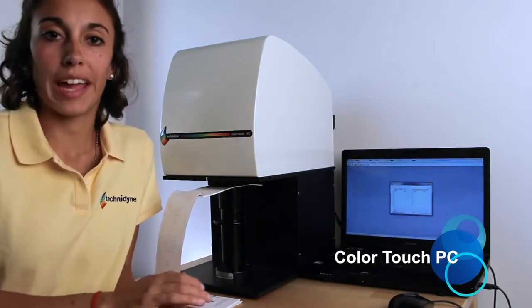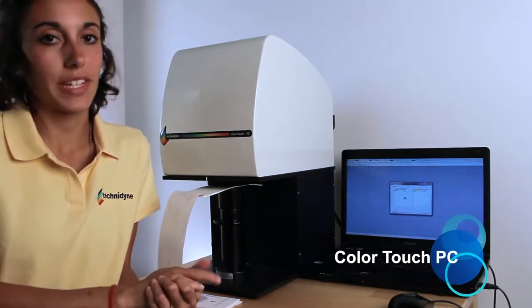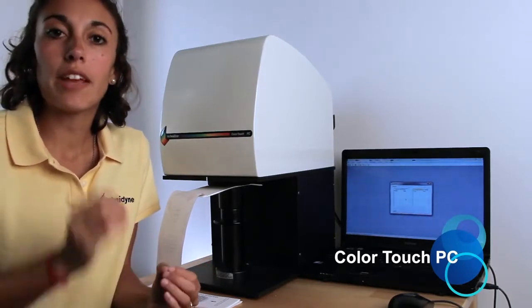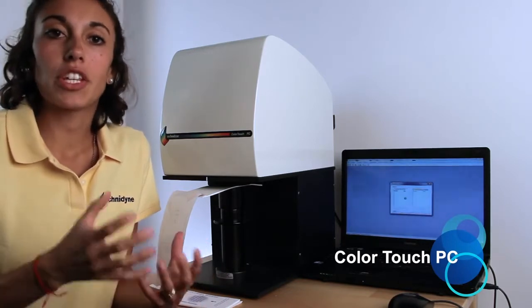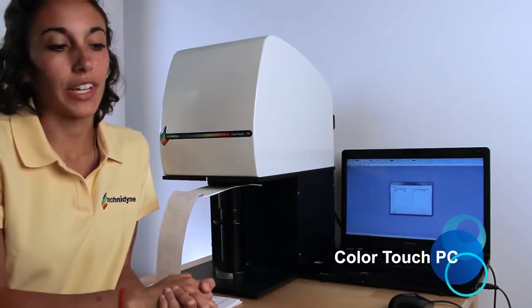Now it's doing the initial spectral calibration at the multiple filter positions. You're going to hear a series of motor noises. That's just the UV filters and the internal swing-in standard working.